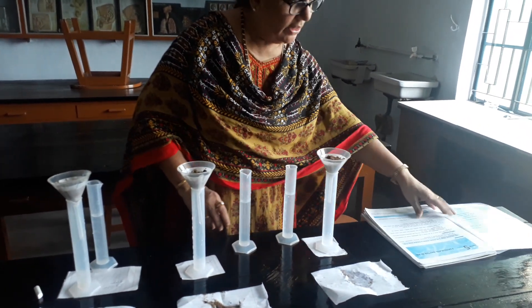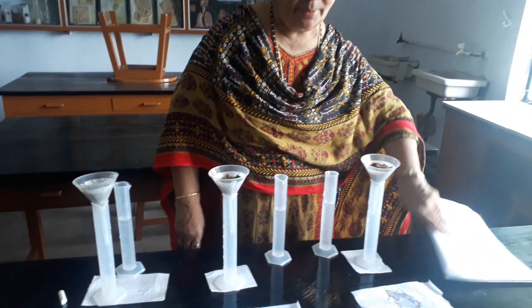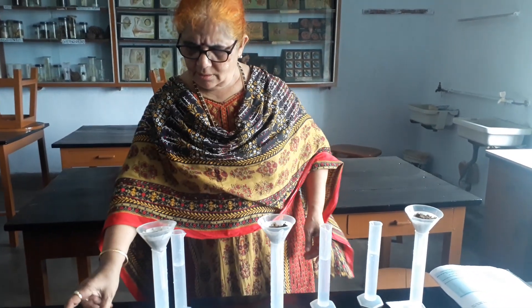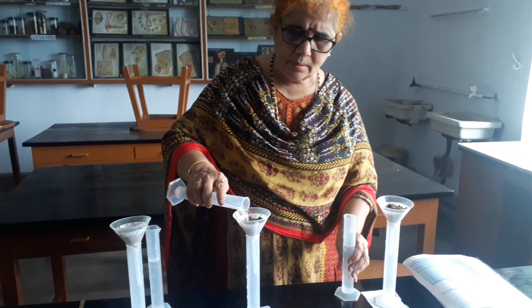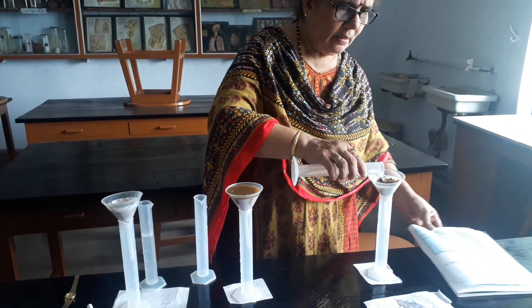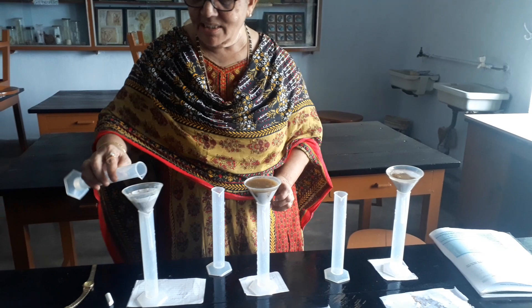Now the observation table is there and we will note down the observations. I am keeping the watch here. You can do a single one also; double is also fine. So I put 50 ml in each. This is time zero. Now I will see after 5 minutes how much water has filtered through each soil.